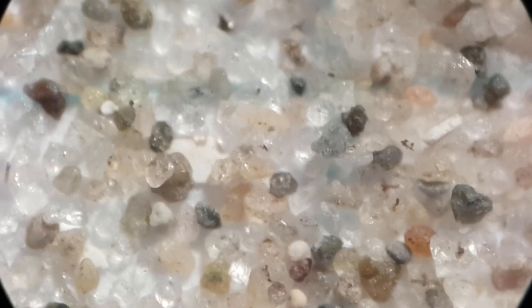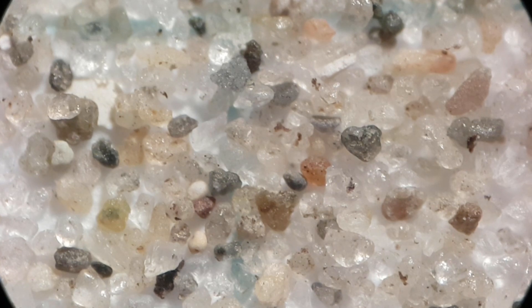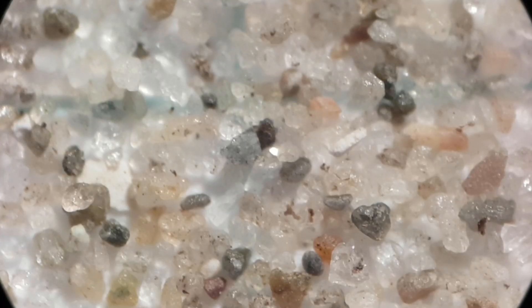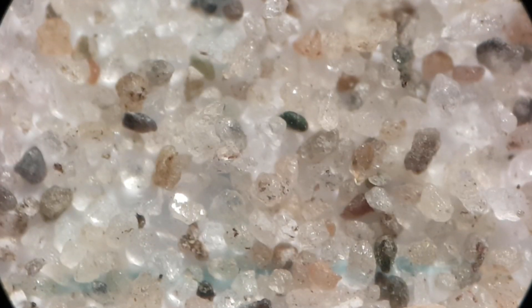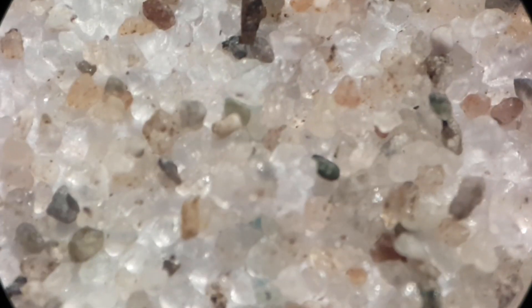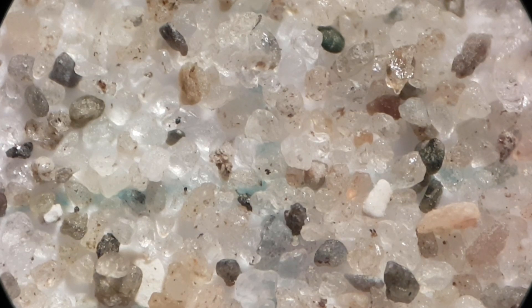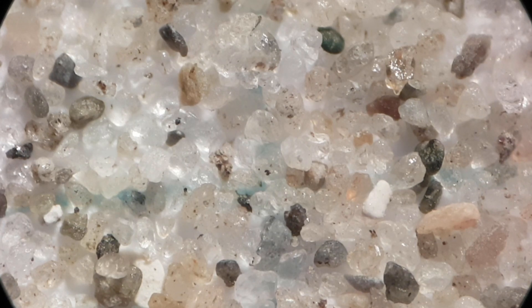Let's see what interesting cool stuff we can find. What we see here is sand magnified quite a bit, and to be honest it looks kind of just like I expected. I've seen pictures of sand magnified a whole lot and they looked really cool, but this is kind of disappointing. It's still interesting — you can see some structures clearly — but they just look like little rocks, which is honestly what I expected.